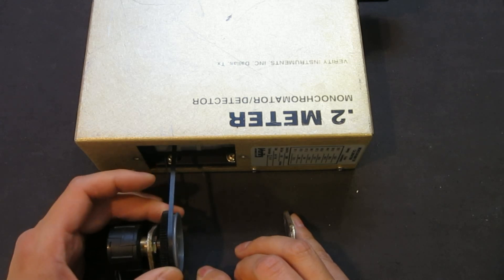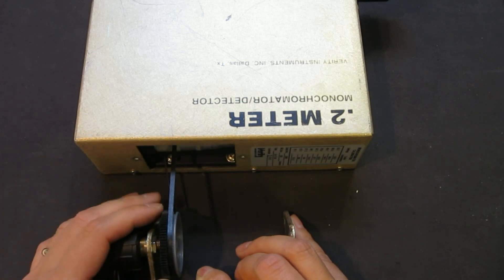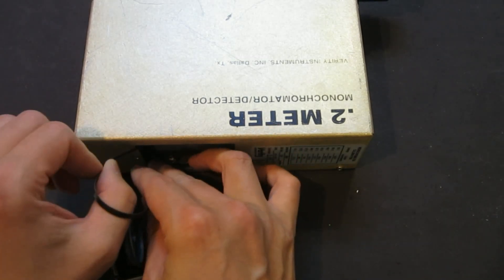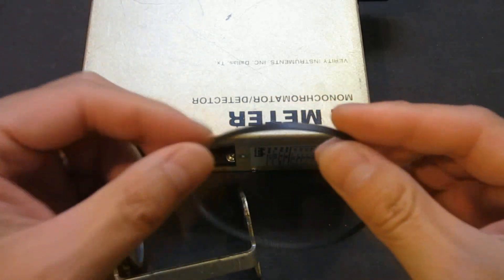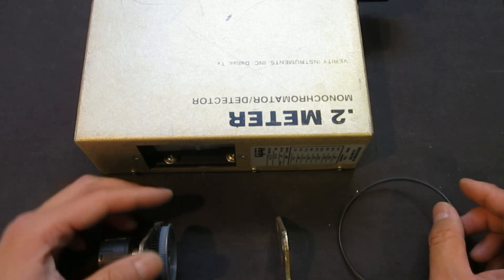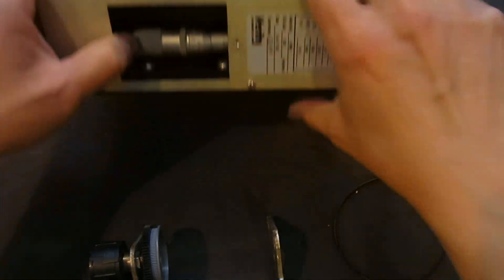So hopefully, as you will see later, I plan to route the signal to a PC and do some data processing. The beauty of this is that because the cogwheel belt is relatively stiff — meaning it's not like a rubber band — you don't really need to put much force on it at all for it to turn synchronously with the dial. So that is quite beneficial.